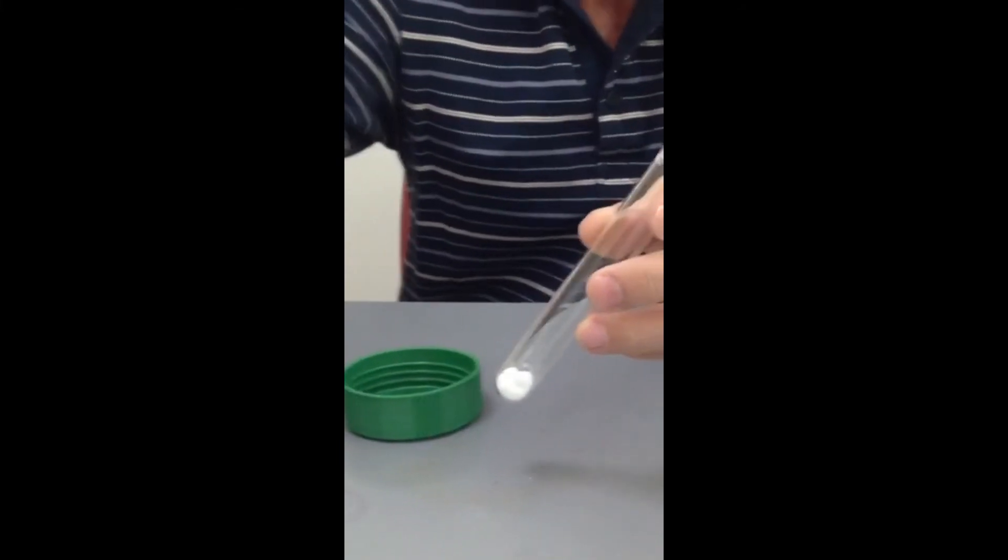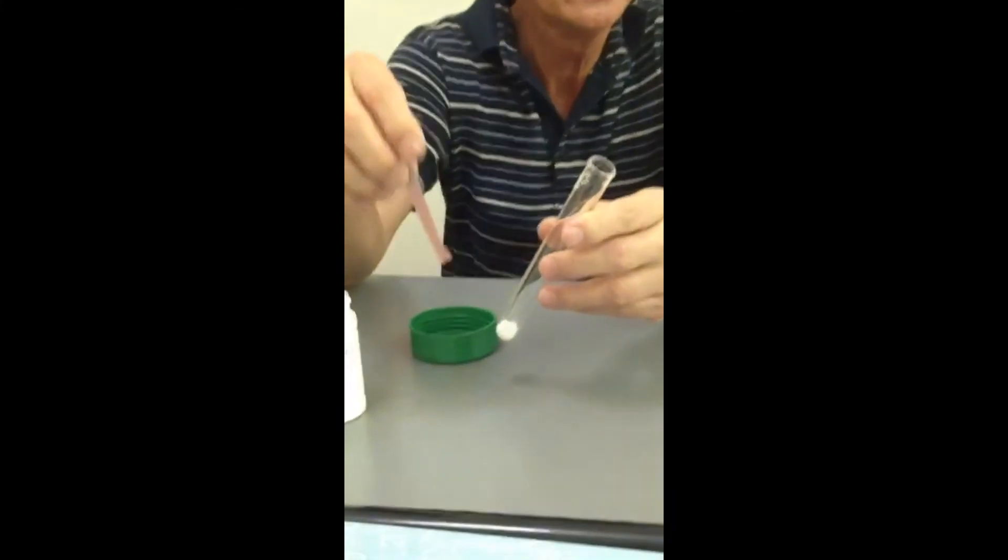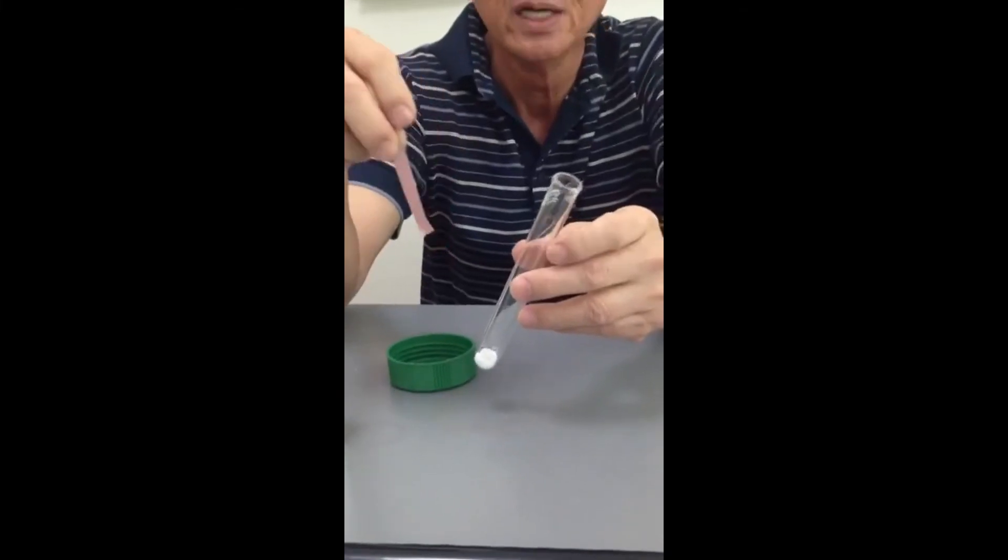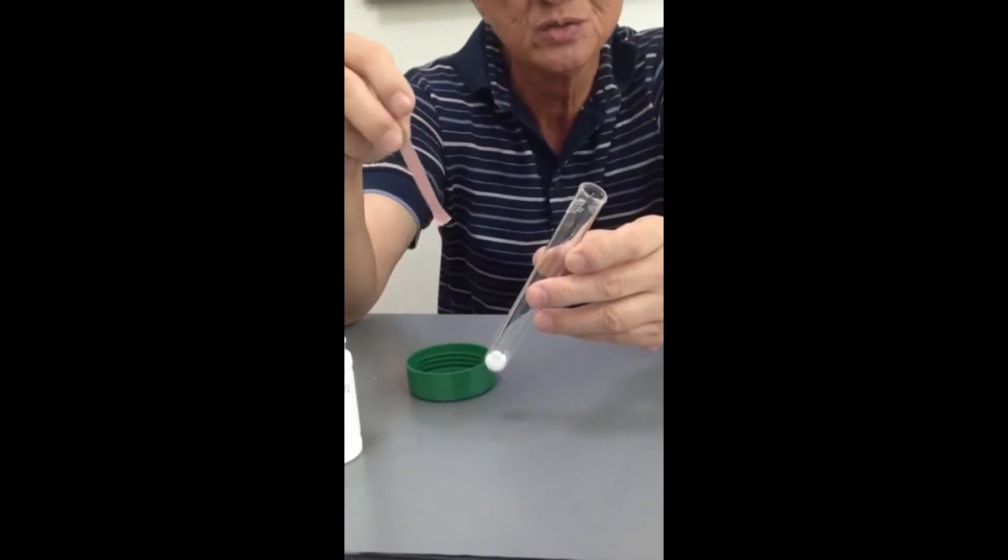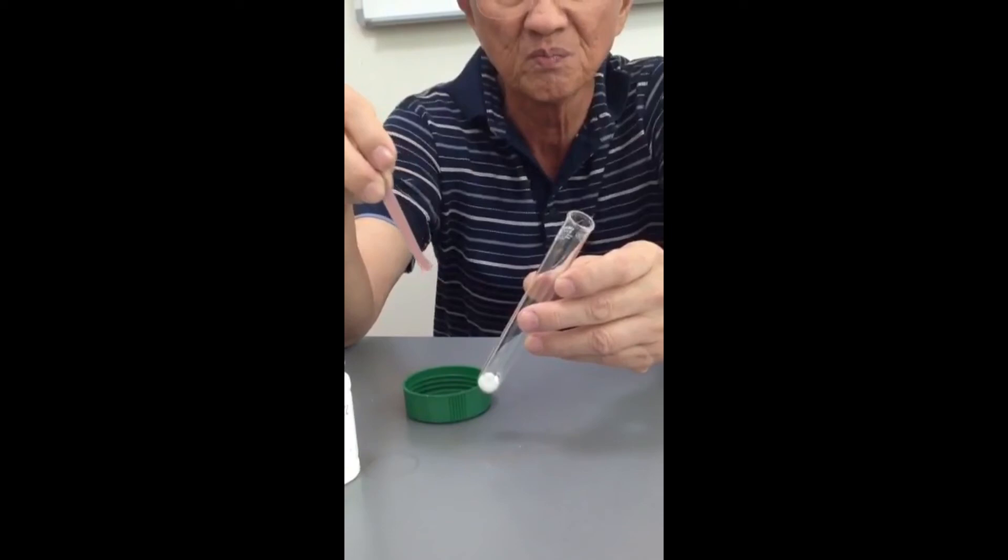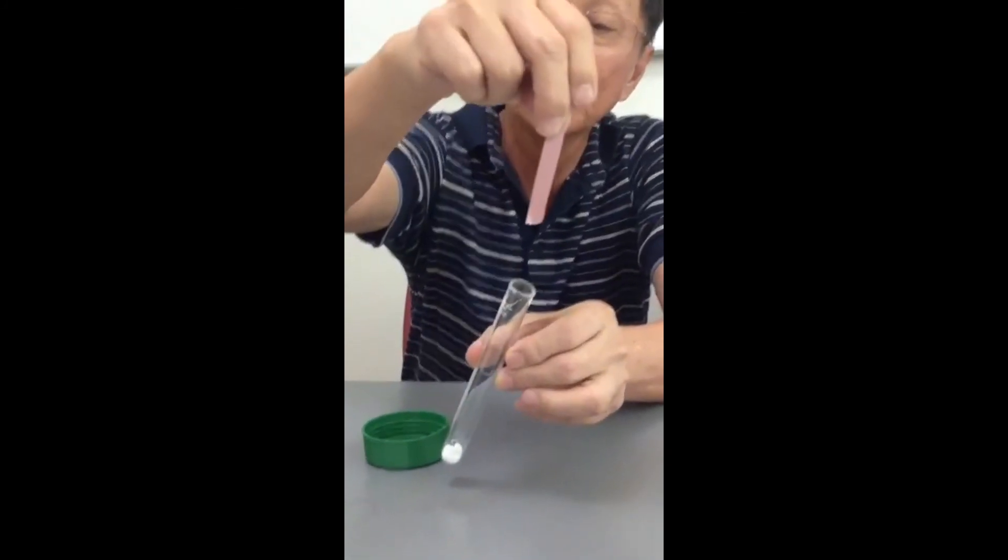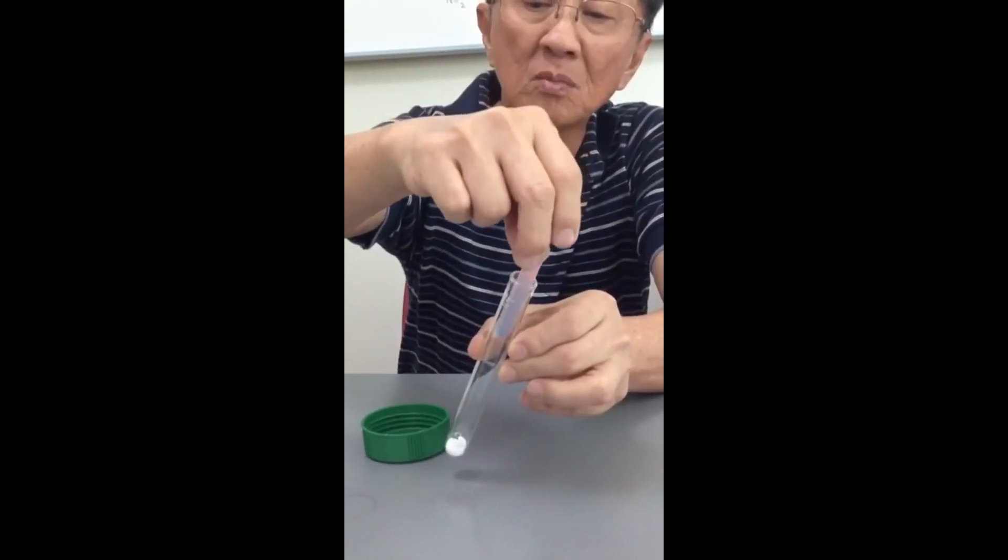We then have this red litmus paper inserted inside. This red litmus paper again uses some moisture from the atmosphere, and it should turn blue. Here.